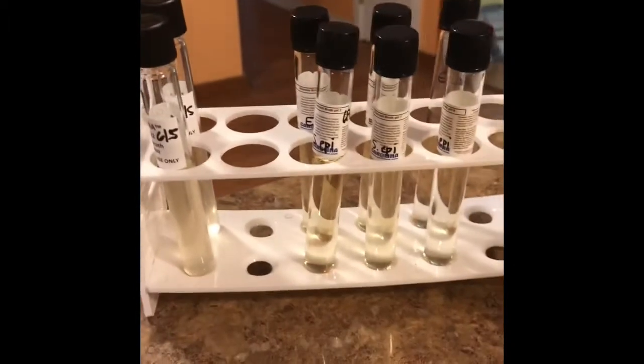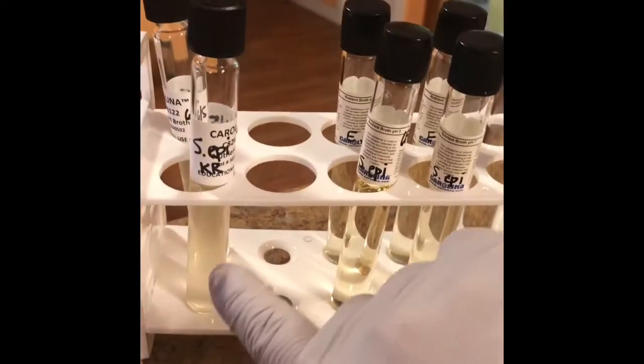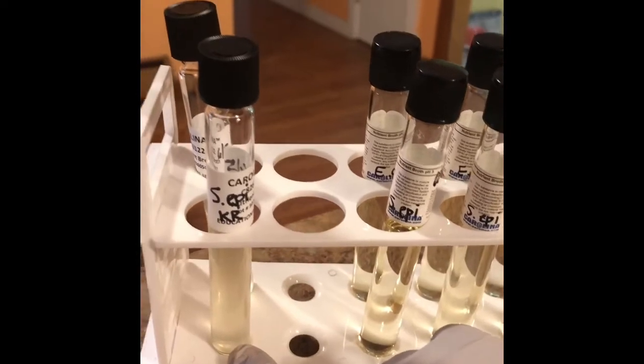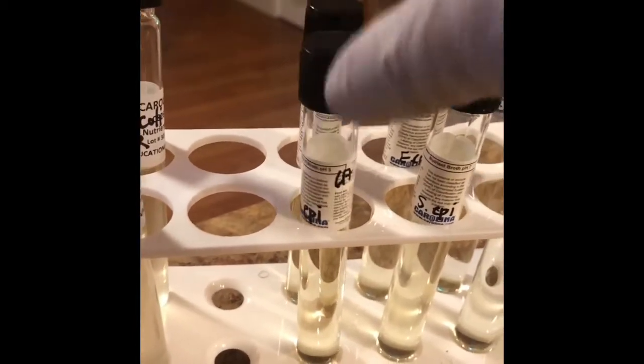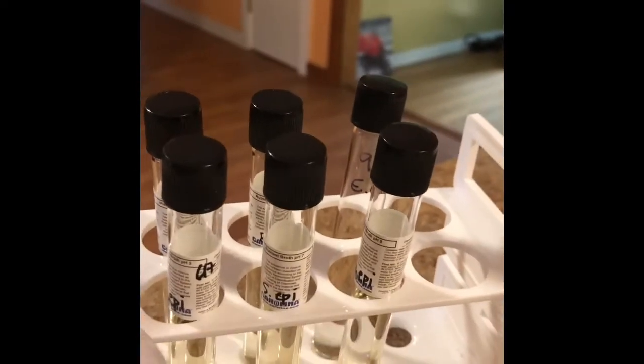Just like for the water activity lab, and I won't make you sit through it, there's the culture that I have of staph epidermidis that I inoculated on Friday, and I have my E. coli back here. Then I did the same thing as before. I labeled one of these tubes with the date and my initials. All the other ones just say staph epi. So I have a pH of 3, 7, and 9 for staph epi, and then the E. coli ones behind there.